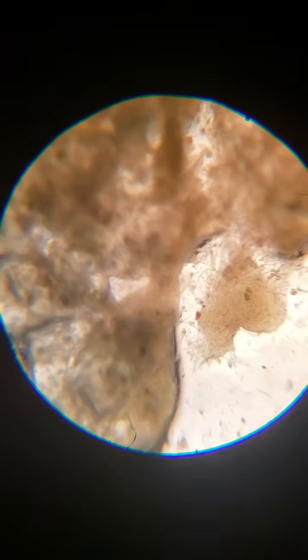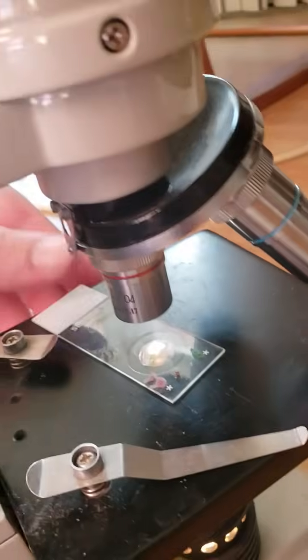So, all right, guys, I know that was kind of long and wordy. I apologize for that, but let's pop this off real quick. Okay, let's pop this off and let's show you guys what we were looking at. So what we were looking at is this stuff: blood, leaf, bacteria. There's the sponge right here with the diatoms on it, and the algae, the other kind of algae, and then the bacteria. So that's what's going on there.